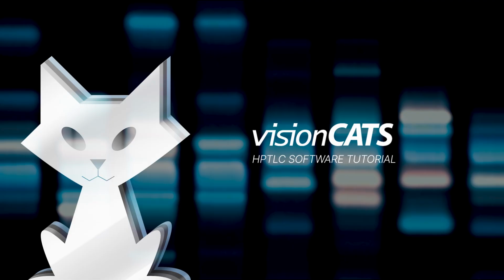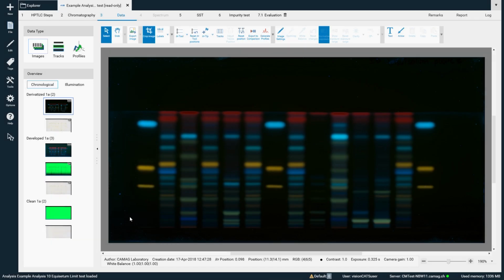Welcome! In this tutorial, we'll explain the Clean Plate Correction feature in visionCATS, which improves background correction for more accurate image evaluation. The Clean Plate Correction feature enables the subtraction of an image of a clean plate prior to sample application from the images recorded after chromatography.